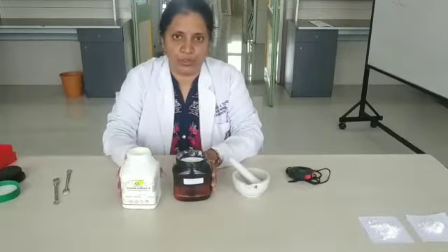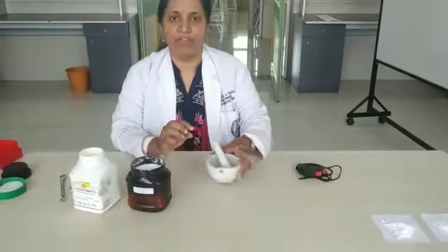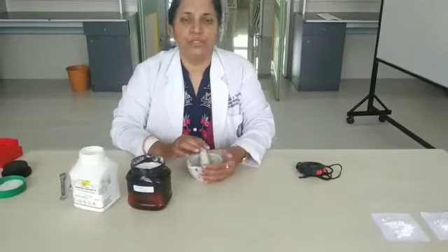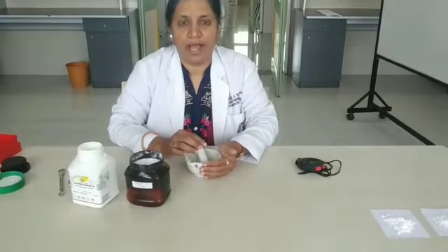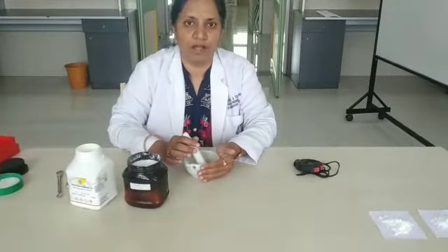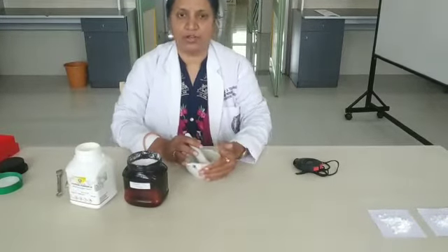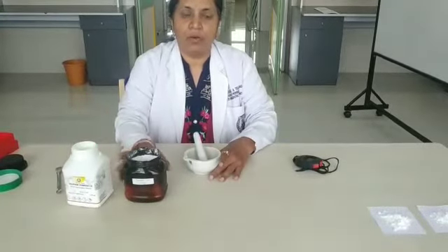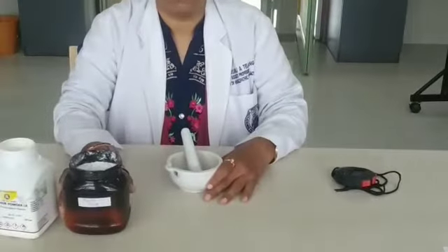We are going to do trituration here. Trituration is an ideal physical process of potentization where you use insoluble drug substances and sugar of milk as a vehicle, and by continuous grinding for one hour you are going to reduce the size of the particles. The aim will be to prepare 1x potency from crude sulphur.